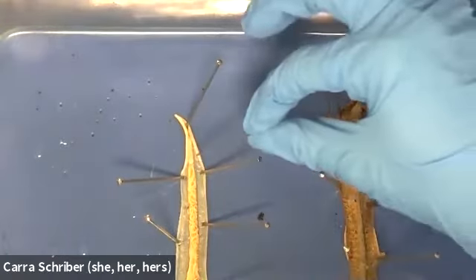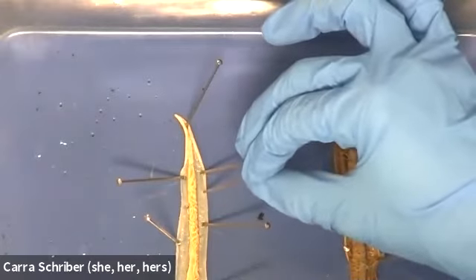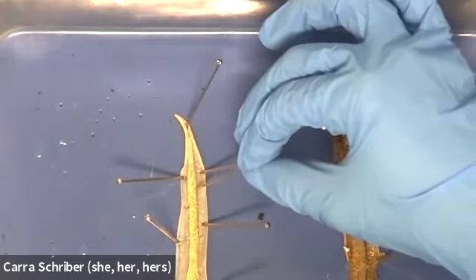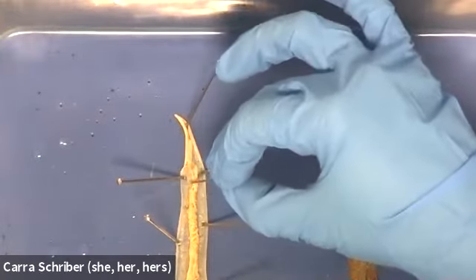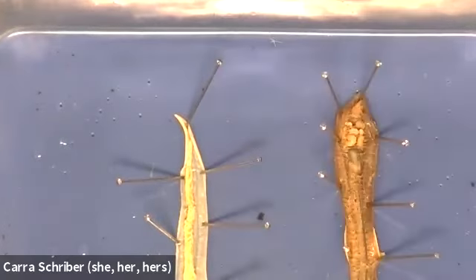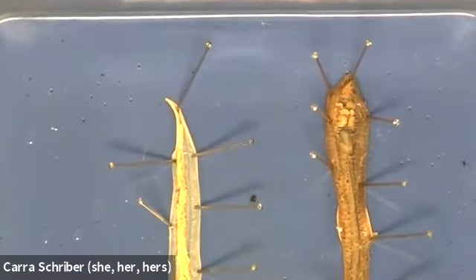So here, when we're looking at our roundworm, you can see that the ectoderm came very cleanly away. And if I push these organs, I can just push them all the way out to the side. They'll just go wherever. There's not a lot of connective tissue that's keeping those organs in place. And that kind of comes down to that thought process about pseudocoelomate versus coelomate.